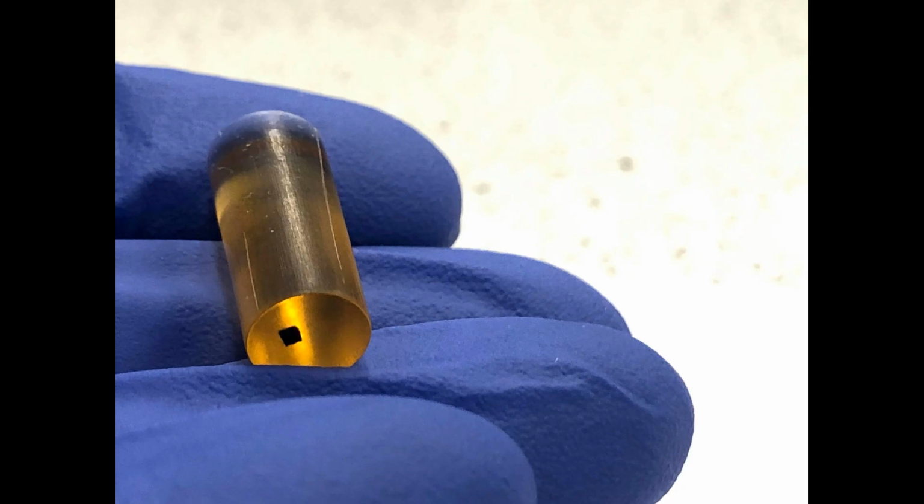So you can now follow the next stage of the specimen journey, which is microtomy. You're going to learn all about it, but this is where the block is now going to be cut to produce microscopic sections. I hope you enjoyed this video and thank you so much for watching.